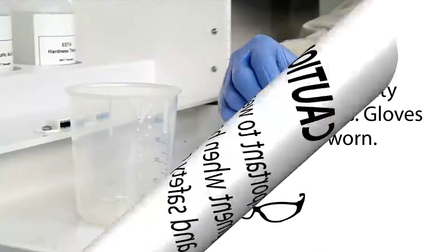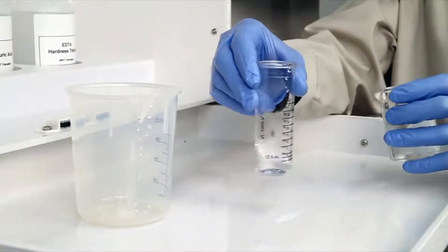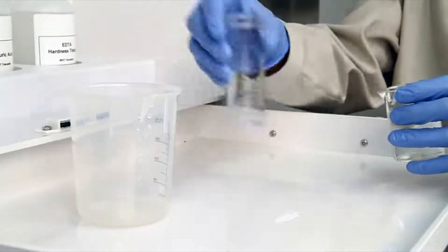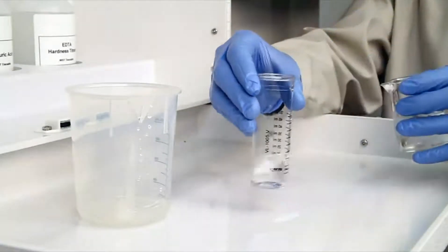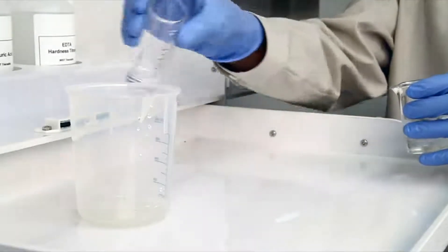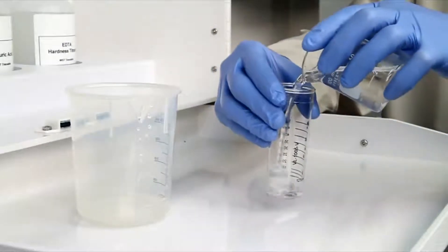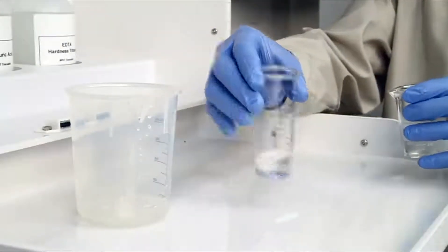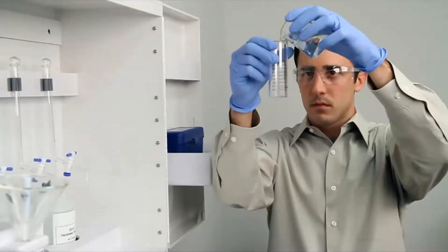The first step according to the Endpoint ID procedure is to gather an accurate sample. The smallest change in sample size will lead to inaccurate results. Before gathering your sample, it's important to rinse the vial three times with the sample to be tested. This minimizes the chance of contamination from a previous titration.